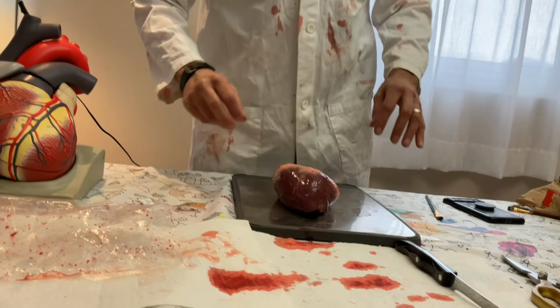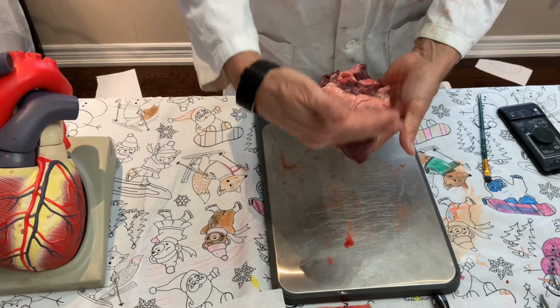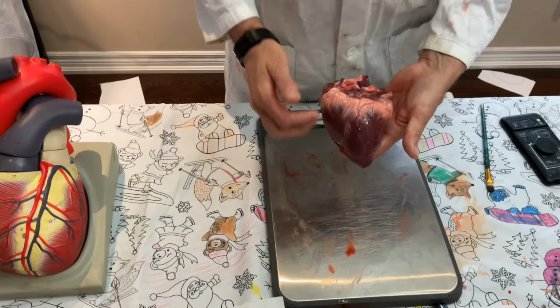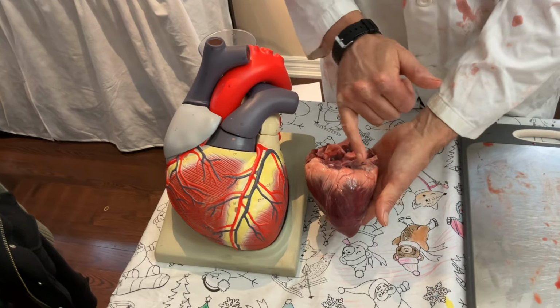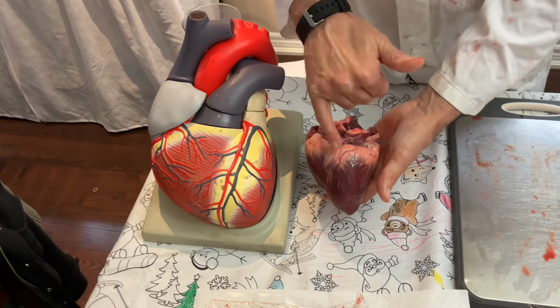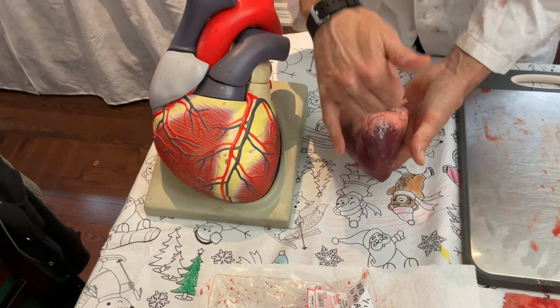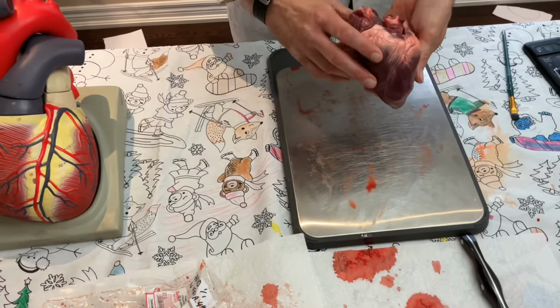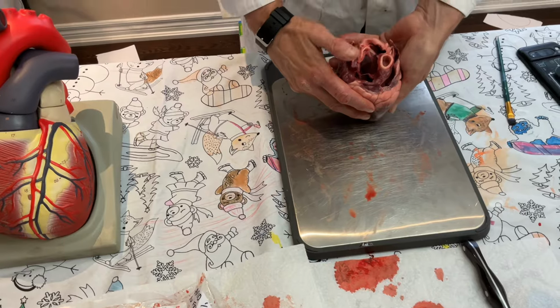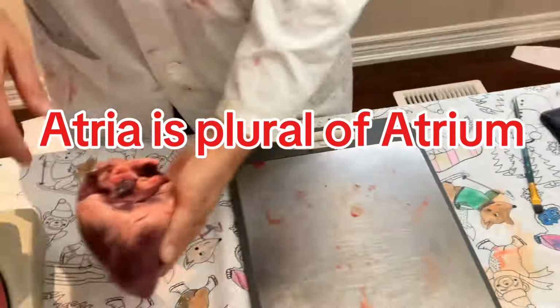Now, let's move on to talking about the actual pig's heart here. Looking at the pig's heart, we are looking at the front side, or the ventral anterior surface. If we compare it to our actual model, you can look at the blood vessels and how they go, like the coronary artery, coronary vein, and you can see that they kind of match up. So it's one way we can know we're in the front. And looking at the top, they've actually cut it open. So you're looking right into the atria, and they've cut off that whole pulmonary trunk here.